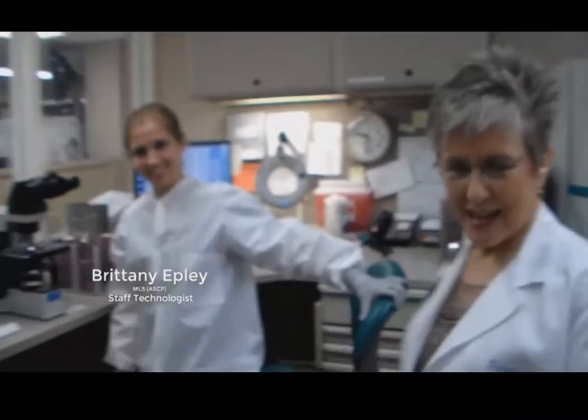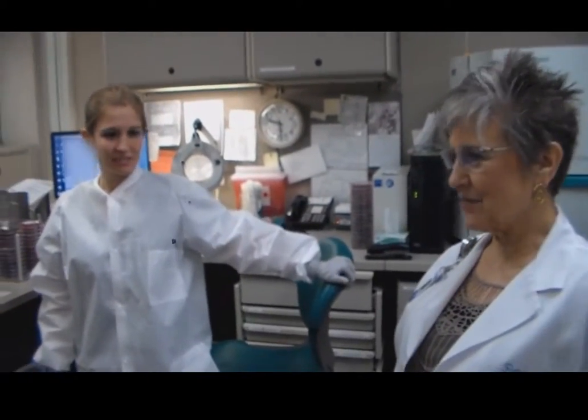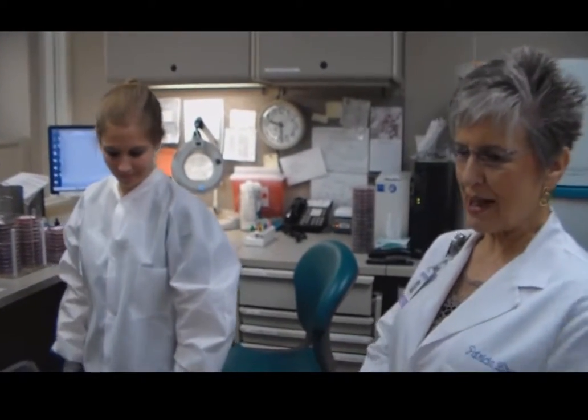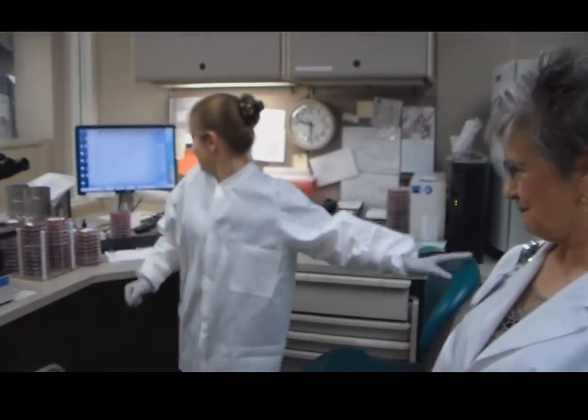This is Brittany Epley, and she works most of her time here in the lab in this department. She's pretty much an expert on microbiology, and what she's going to talk to y'all about is what microbiology does in the lab and how that relates to people out on the street, the general public. How does what we do in here relate to those people?